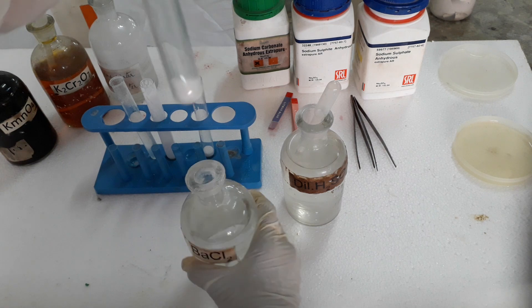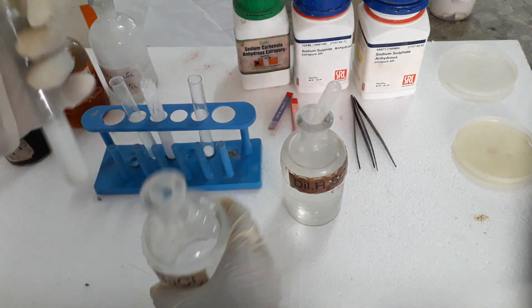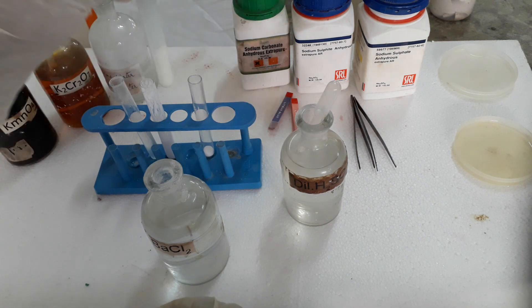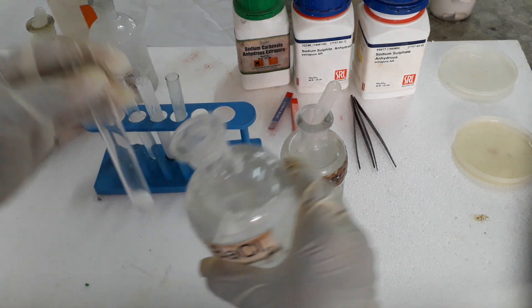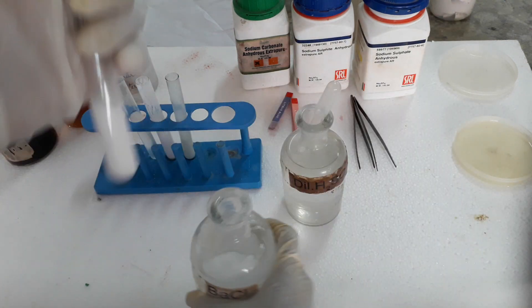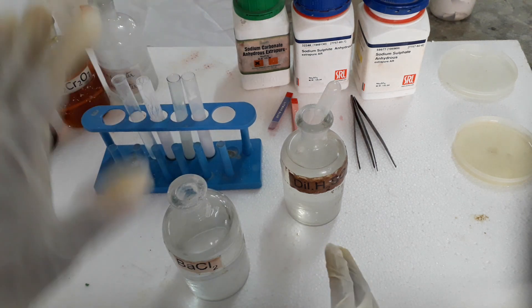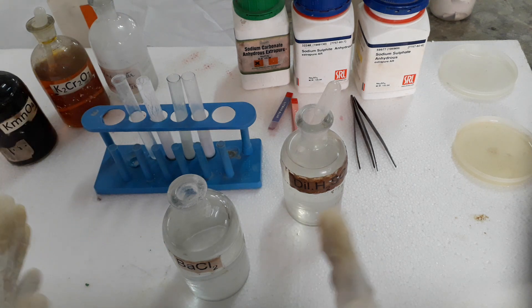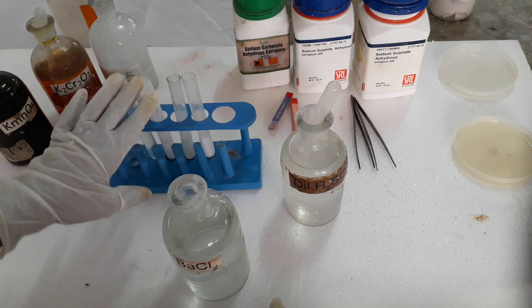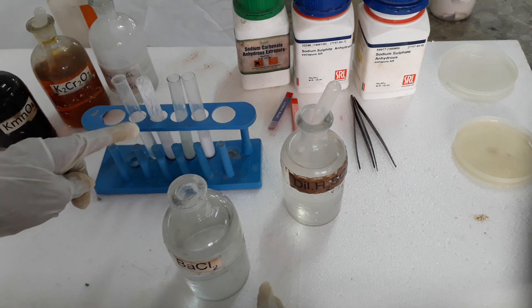Now let us take the second salt, that is sodium sulphite. When you add barium chloride to sodium sulphite, you get barium sulphite — also a white precipitate. The third is sodium sulphate; on adding barium chloride solution you get barium sulphate, also a white precipitate. So all three give white precipitates, meaning the anion may be carbonate, sulphite, or sulphate.